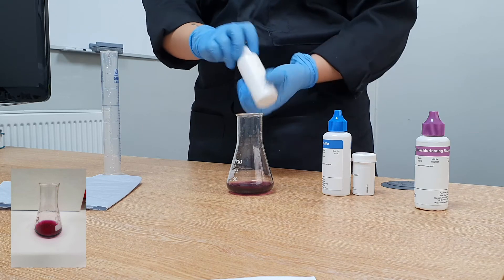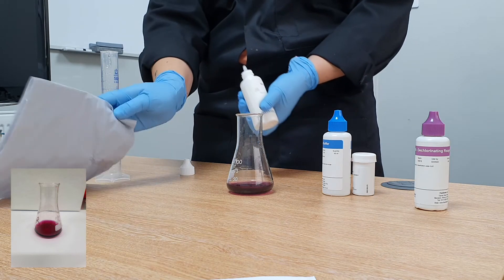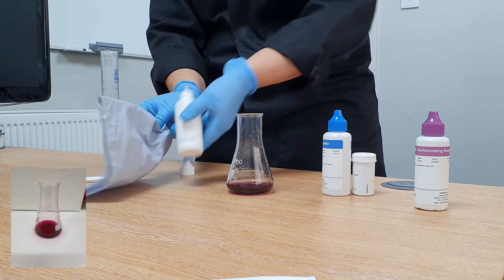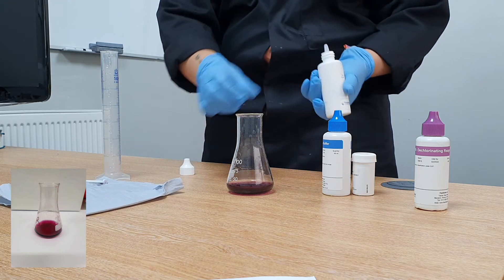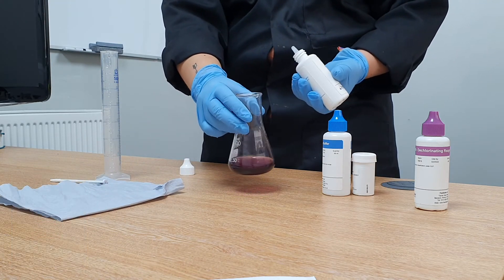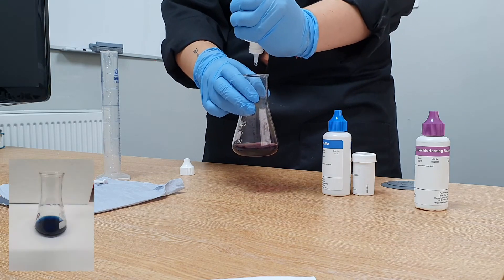Moisten and wipe the tip of the hardness titrant dropper to ensure it is clean. Then add it one drop at a time to the sample, counting the number of drops until the colour changes from scarlet to royal blue.